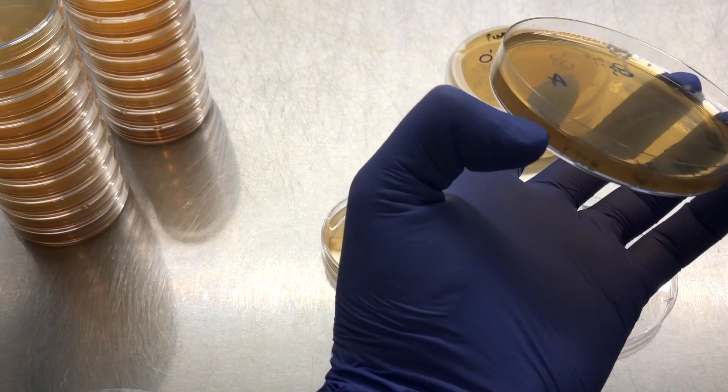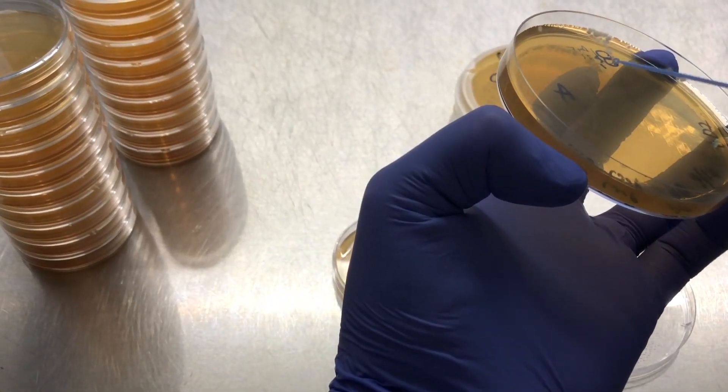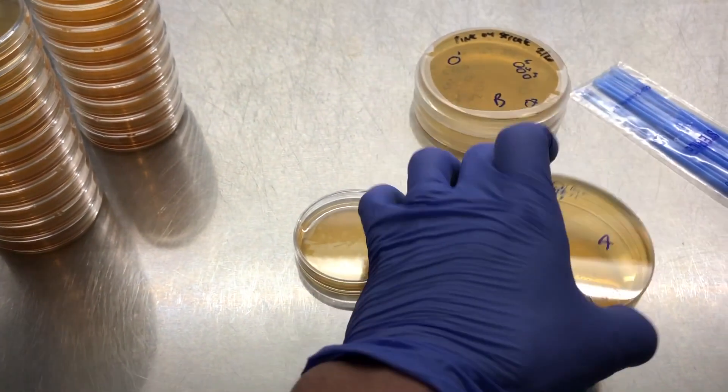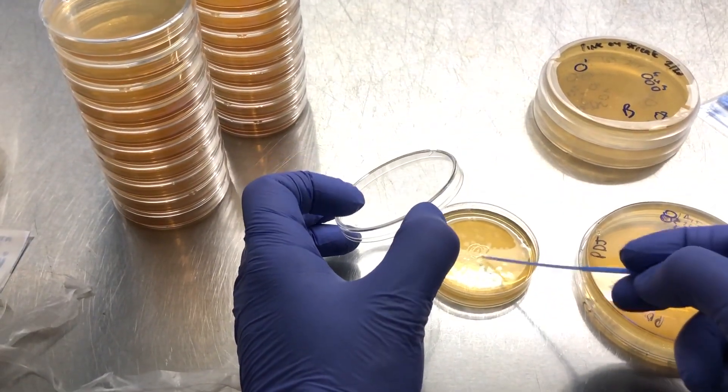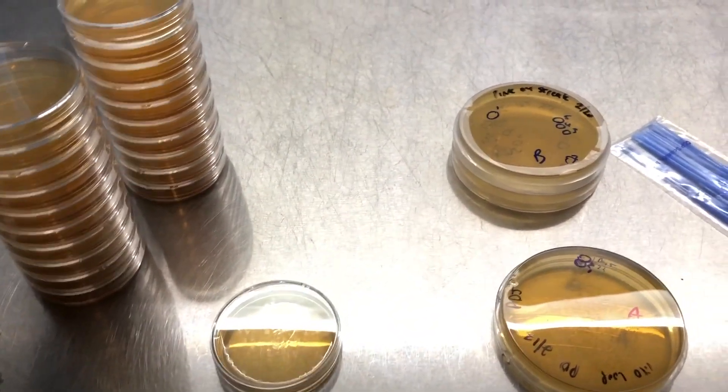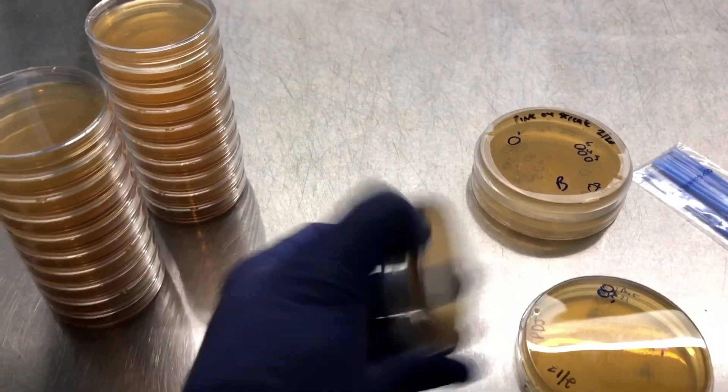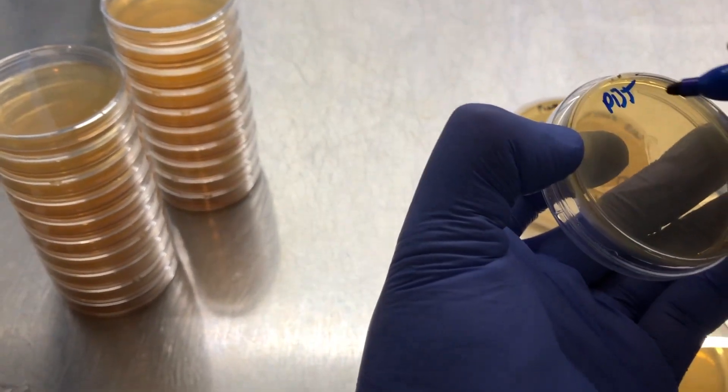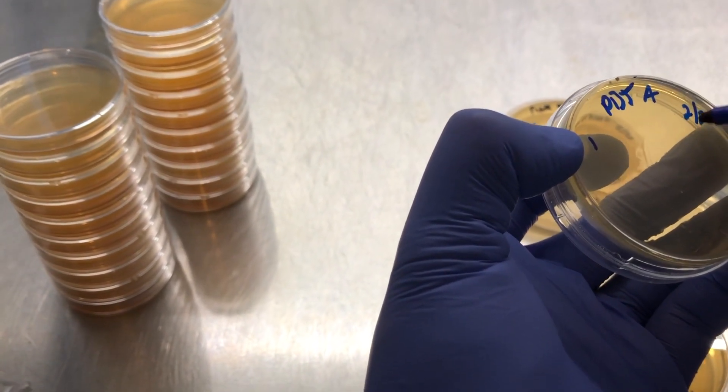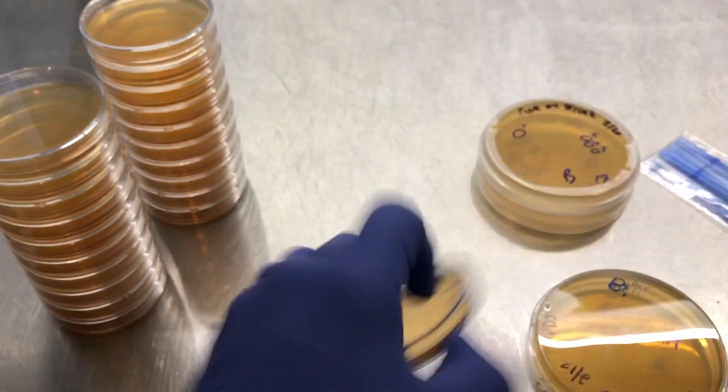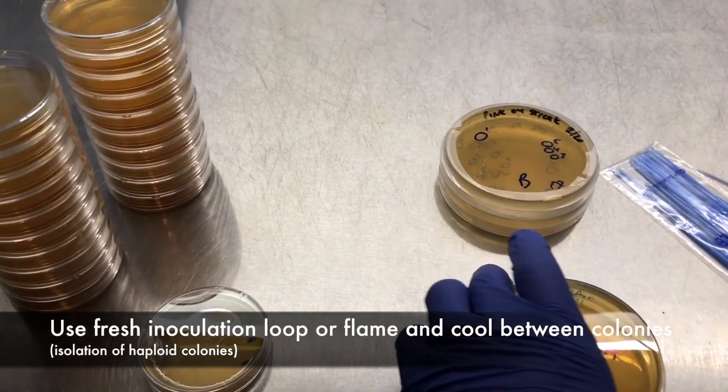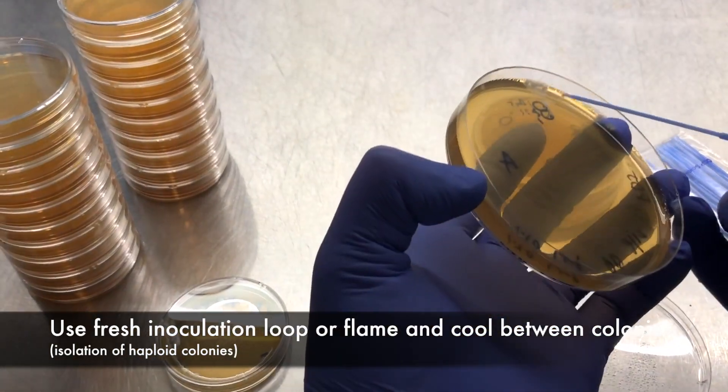So I'll just flip this over. You just want to get enough on there. Okay, so now I'm going to be going for that second colony that's right in the middle.